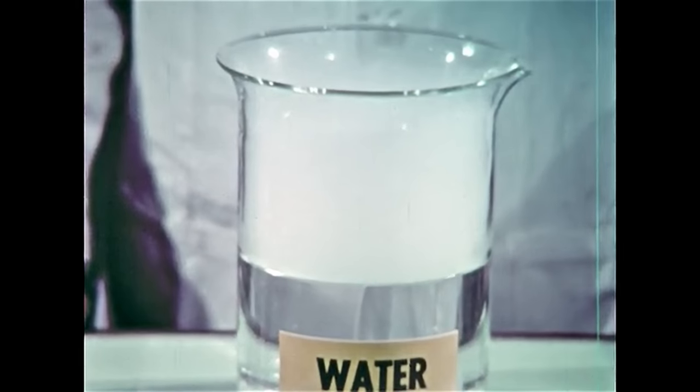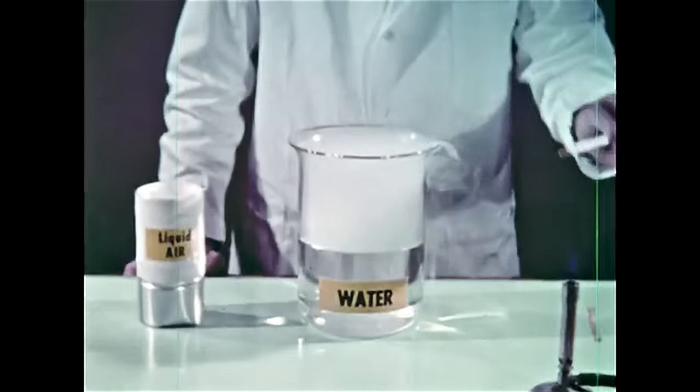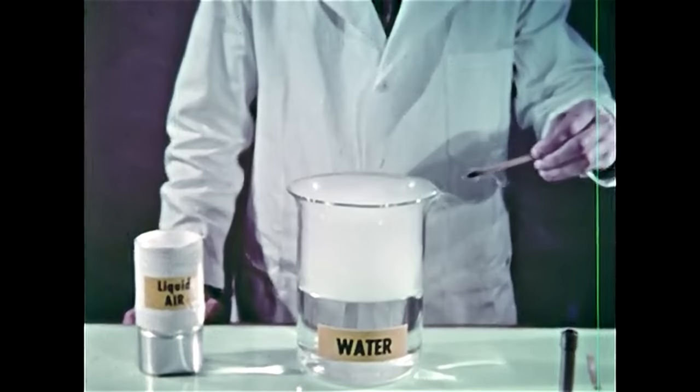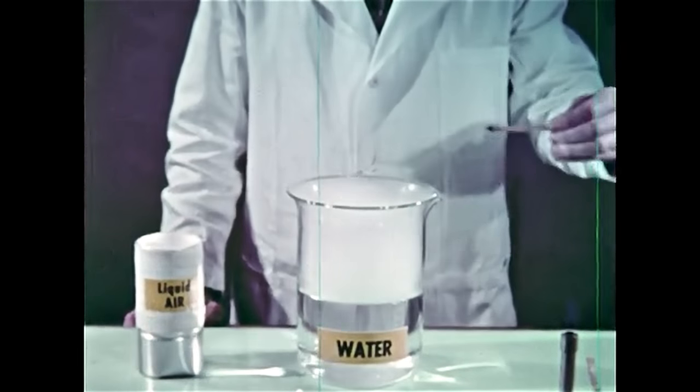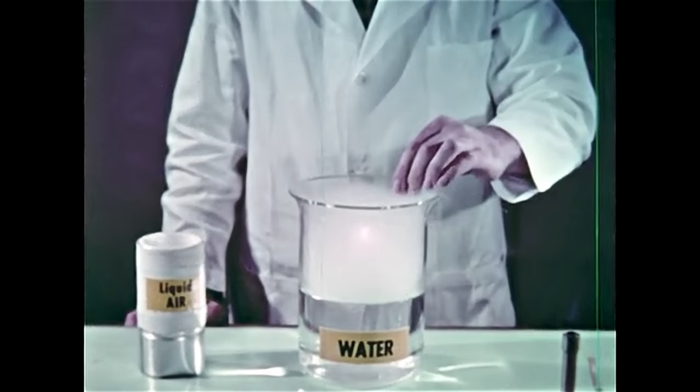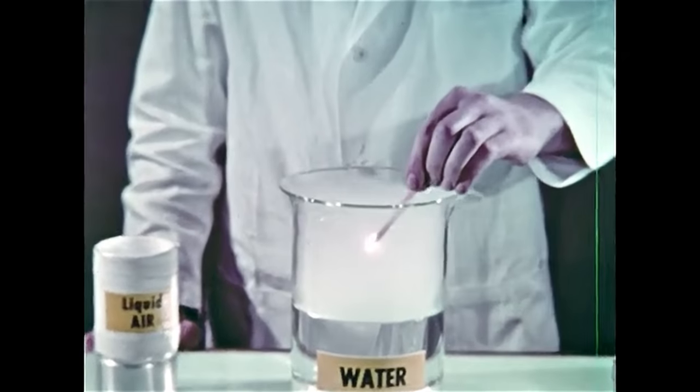The combustion test this time shows that little oxygen is present in this vapor. But when we try it again, we see that we're now getting oxygen gas. This is the chief industrial method because it uses the least energy and the cheapest material, namely, air.